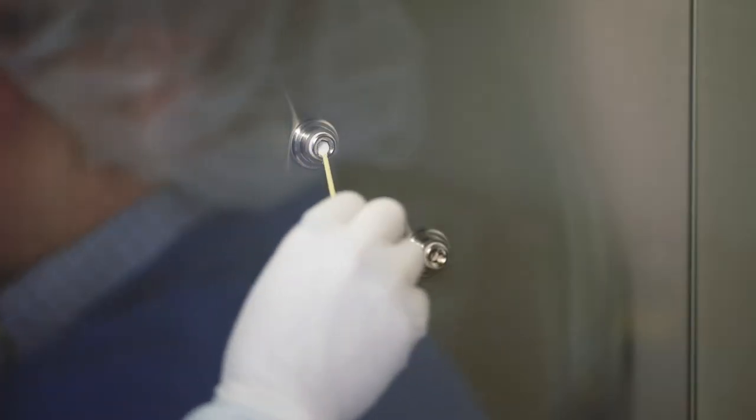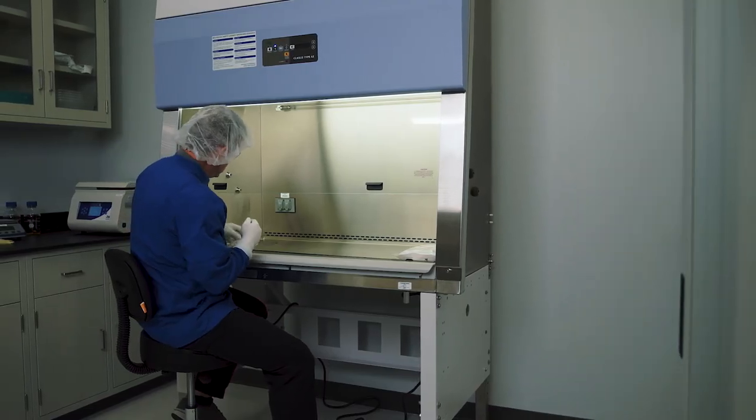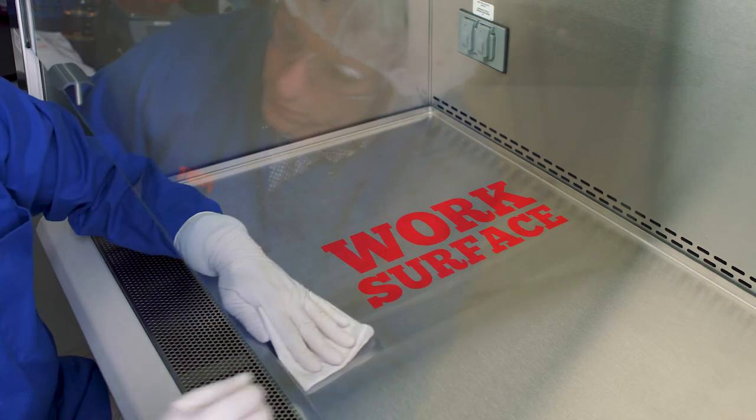Use swabs where needed. For the work surface, you can also use a sterile pre-saturated wipe.